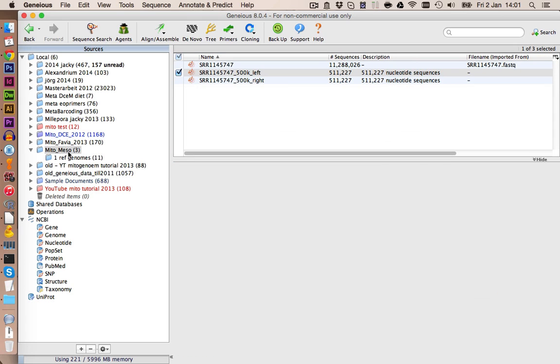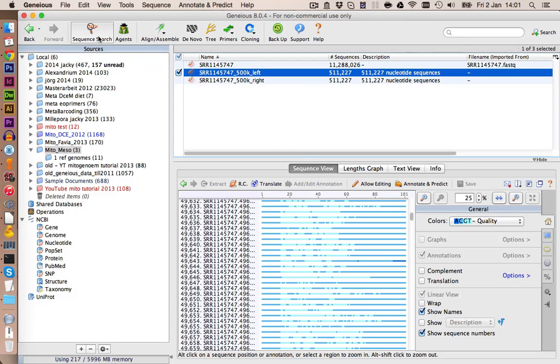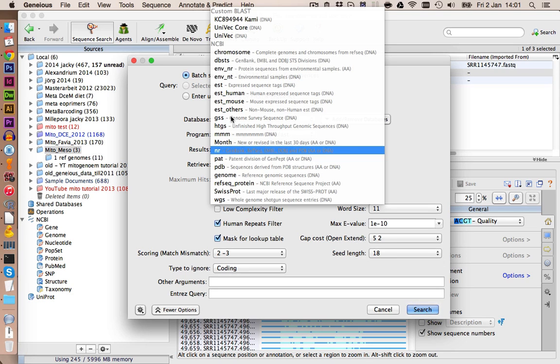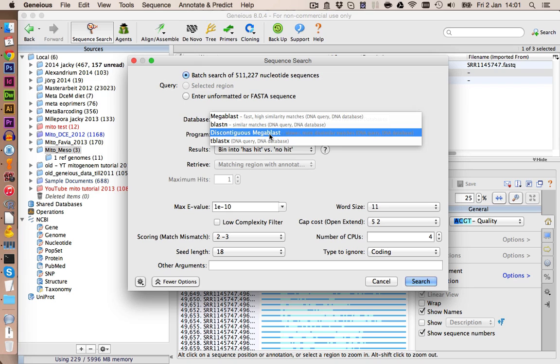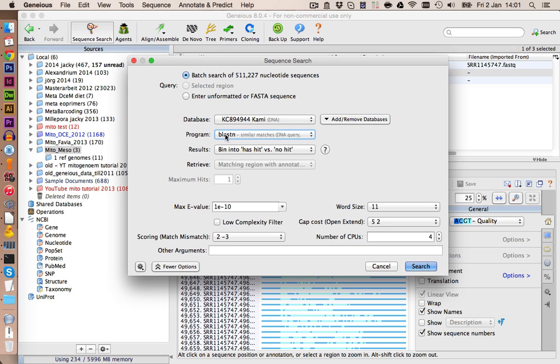We can now go back to our sequencing reads, and let's just select the left ones. And you can go on sequence search, and in here we can select as a database our new database. Now we can also select the algorithm. The Megablast is usually fine. You can also use the BLASTN algorithm. Usually the BLASTN algorithm will give you a few more hits, but it doesn't really matter too much.